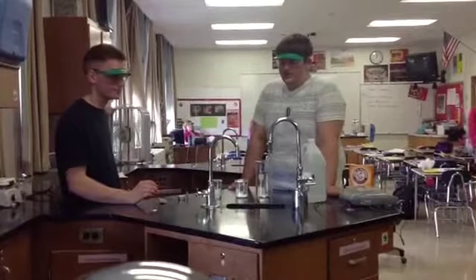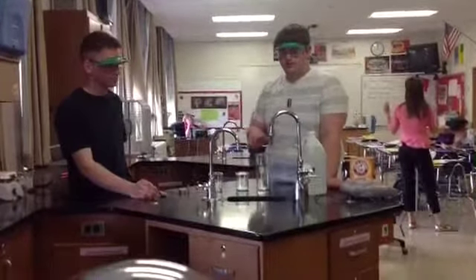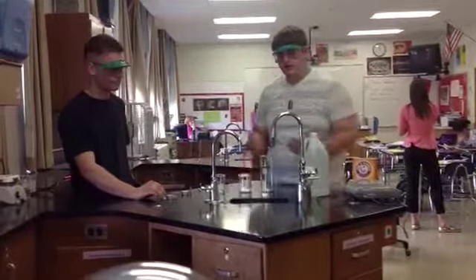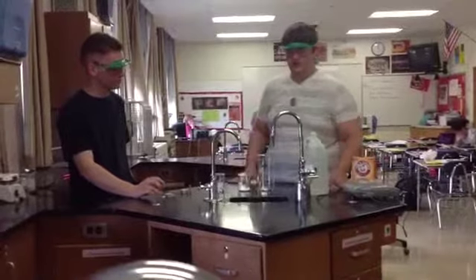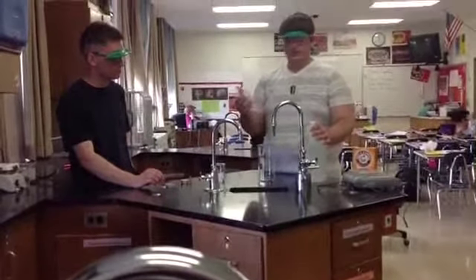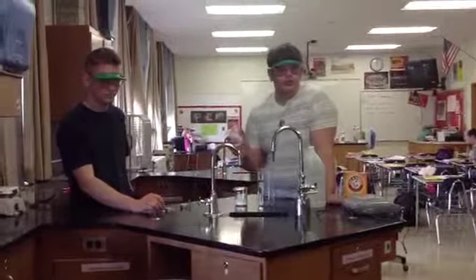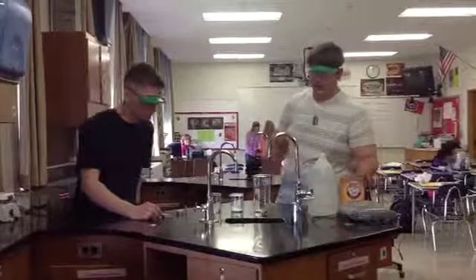What we're simply doing though is we're not pressurizing the gas that's escaped. We're letting the carbon dioxide sink back into this cylinder here. Because carbon dioxide is heavier than air, it will take the form of this glass beaker without escaping into the atmosphere. It's basically 1 gram of sodium bicarbonate, which is your basic baking soda, to 0.72 grams of vinegar. Basic white vinegar used to clean your house.